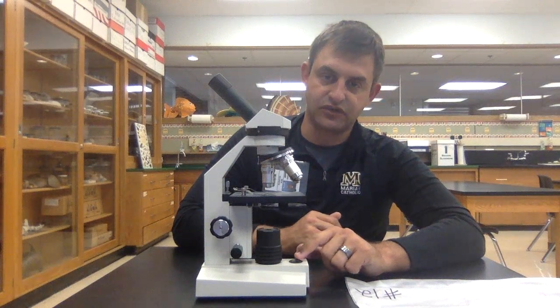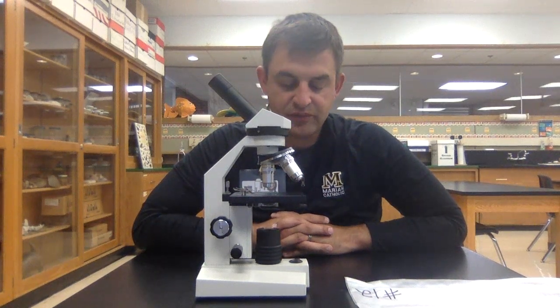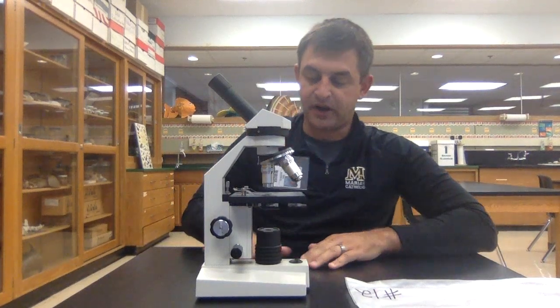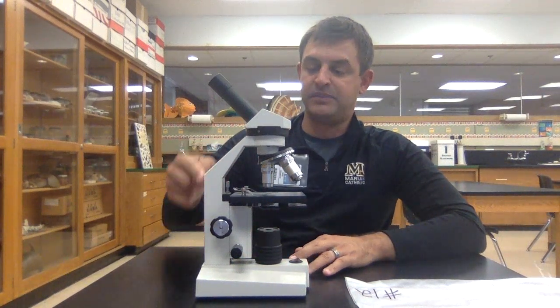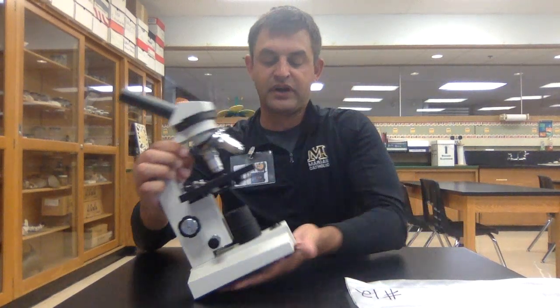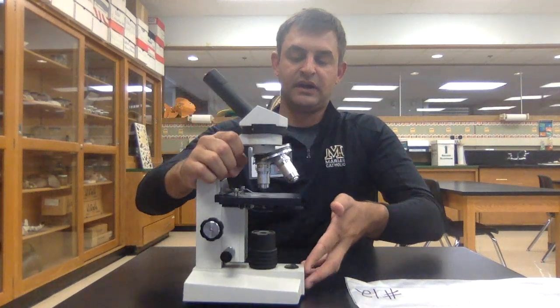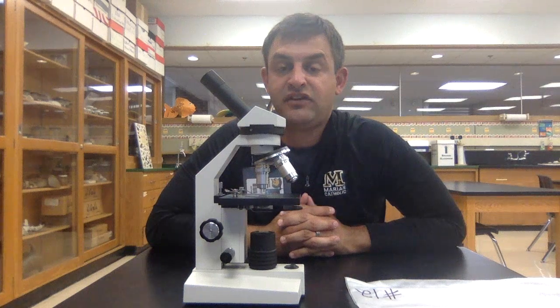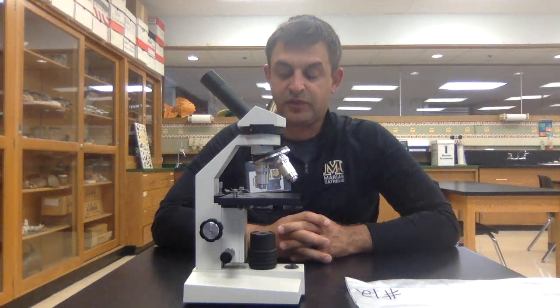Below this, we have the light source, which is controlled with a power switch because it turns on and off. Different microscopes may have different switches, so you just have to look out for that depending on what microscope you're using. The bottom part of the microscope on both sides is called the base. This support structure where the eyepiece and the nose piece are connected is called the arm. When carrying a microscope, you always support it underneath the base and hold it by the arm. You never apply pressure to the stage, the objective lenses, or the eyepiece, because some of those parts can detach or become loose and wiggly and then don't work as well.